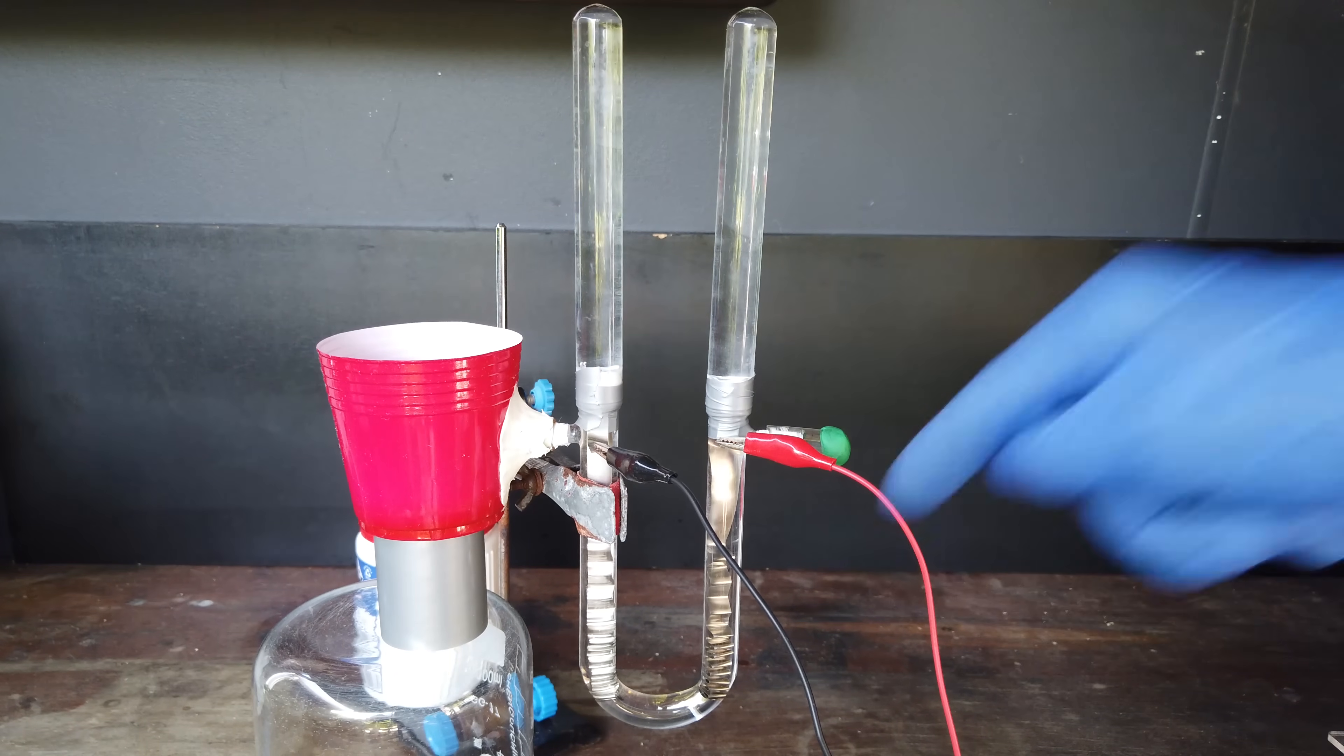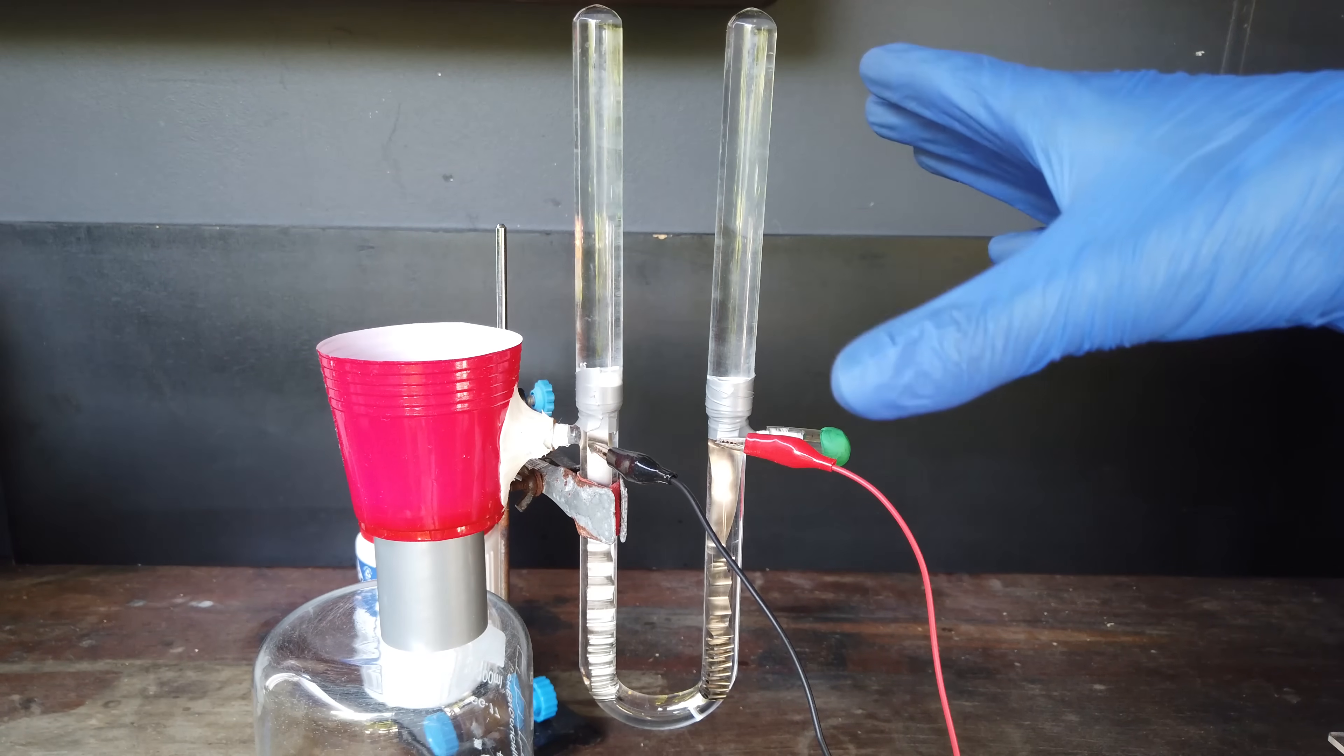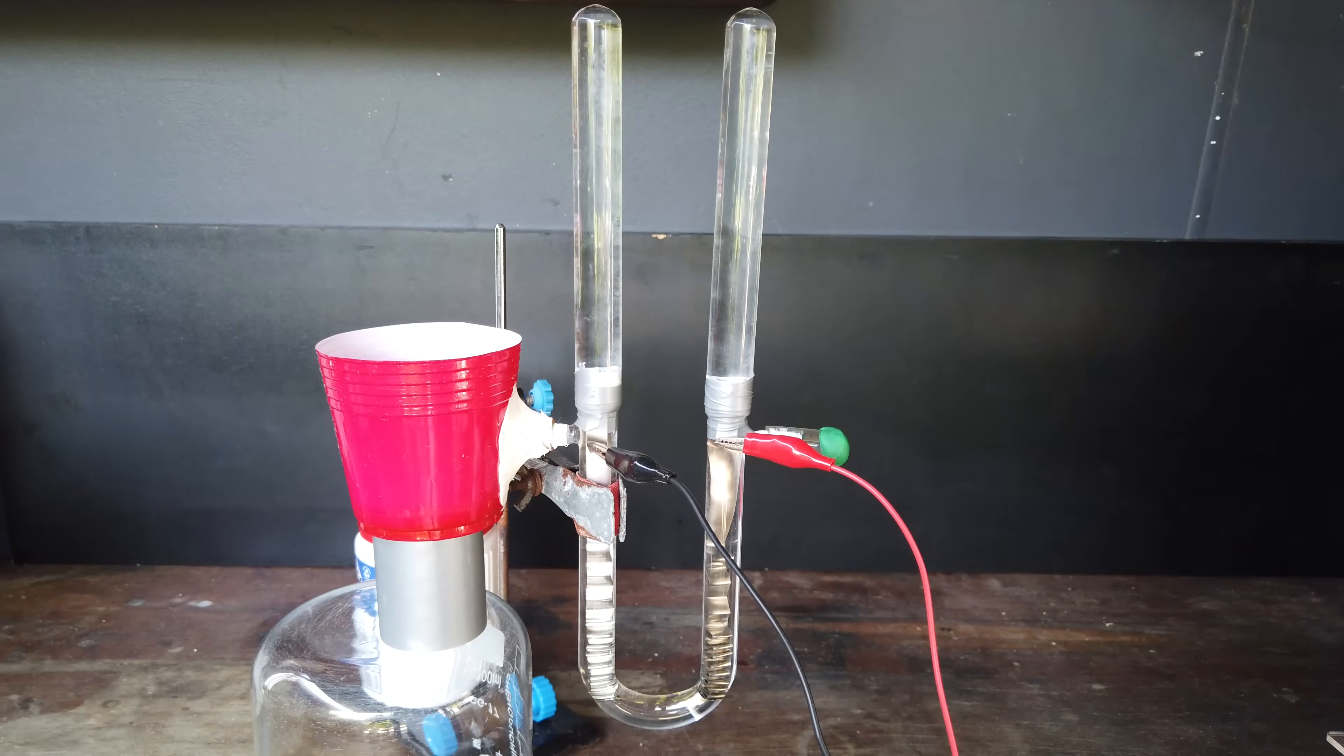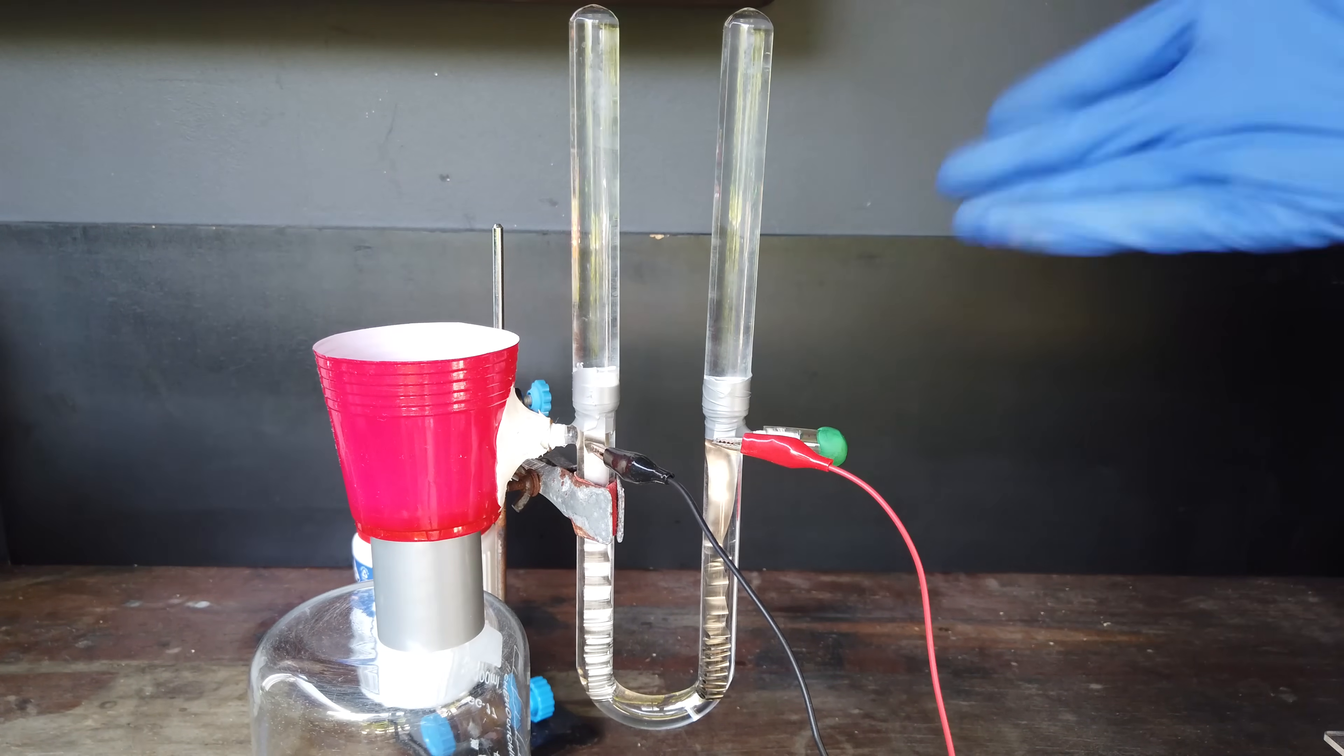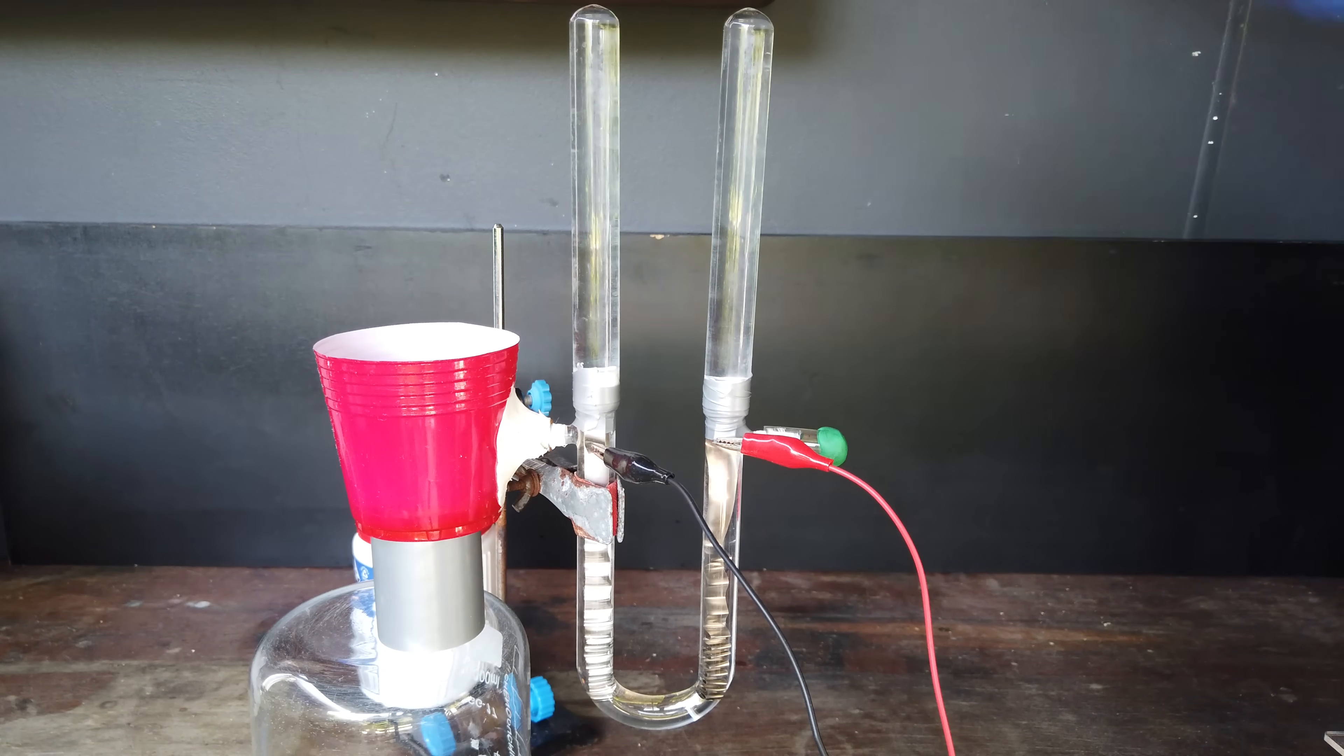Now, once again, we're not going to see much happening because this is an incredibly slow process. I'm probably going to have to set this up overnight and wait for the gases to collect in their respective tubes. But luckily for you, the viewer, we can just skip forward to when we've actually collected some gases. So I'll see you then.